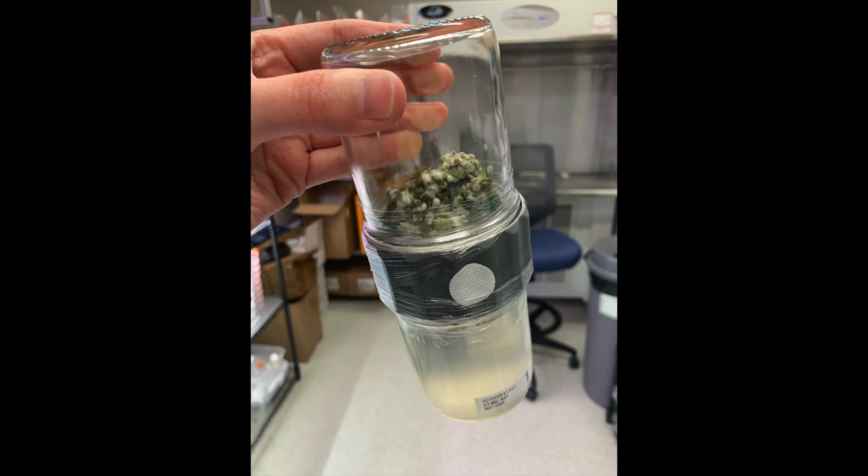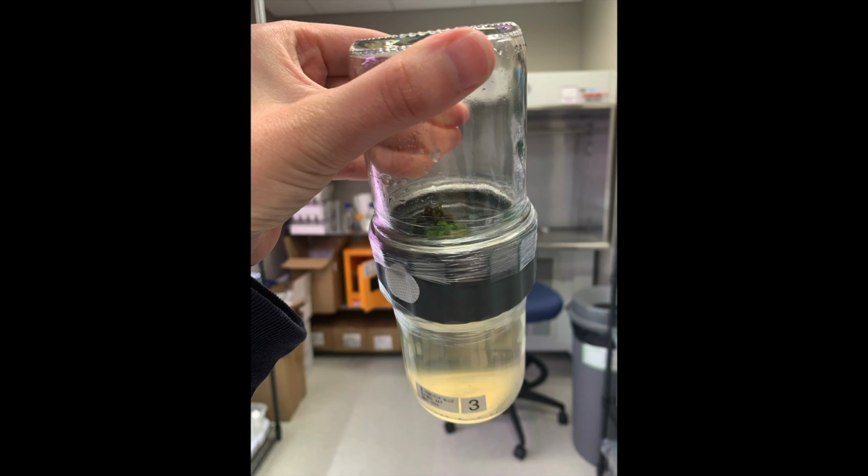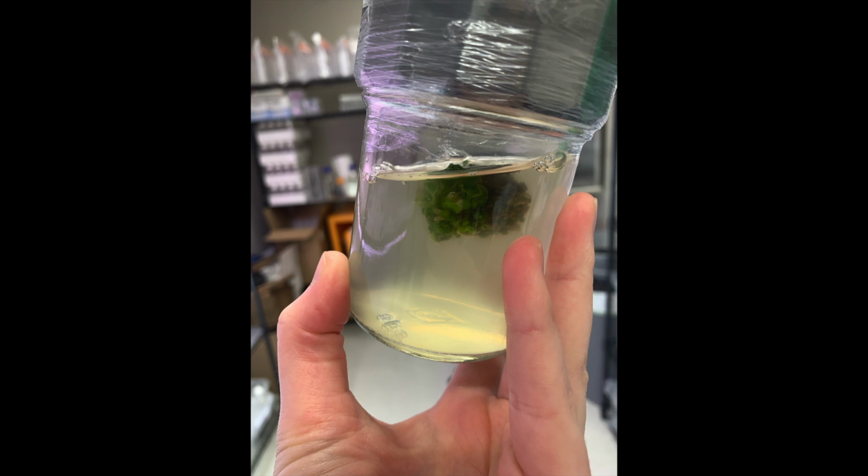Cannabis. The reason that I'm using BioCouplers as opposed to just subculturing these plants onto solid tissue culture media is because if something is contaminated inside of the BioCoupler, you know very quickly. Contamination tends to spread rapidly through the liquid media.